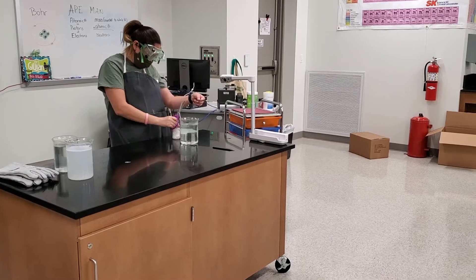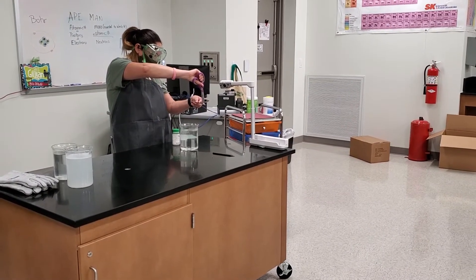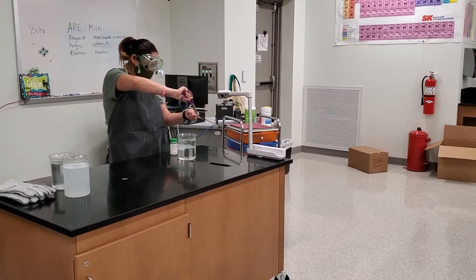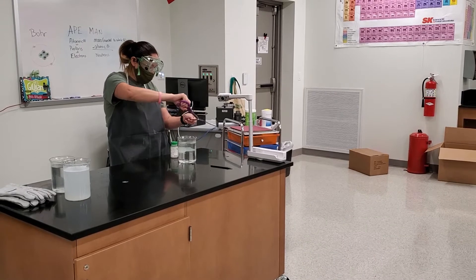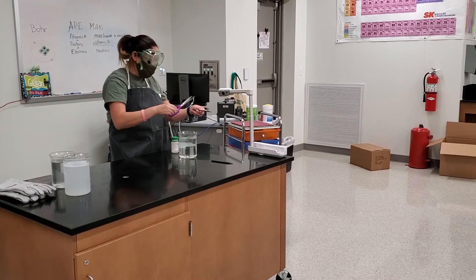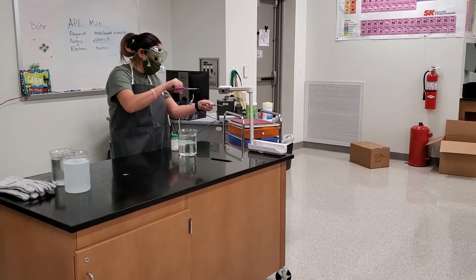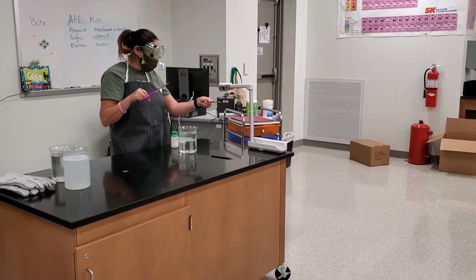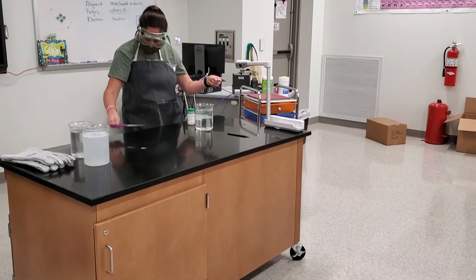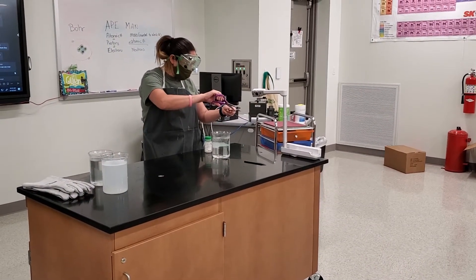So this is sodium, Na, and I'm actually going to just cut through. I didn't go all the way down. There we go. That's a little piece though. So if you look at the fresh cut, it's like shiny, like super white silver shine. And I'll show the camera. So I just did that with regular scissors — that's how soft it is.